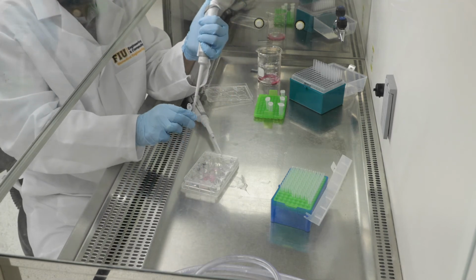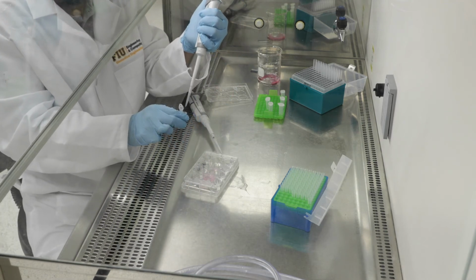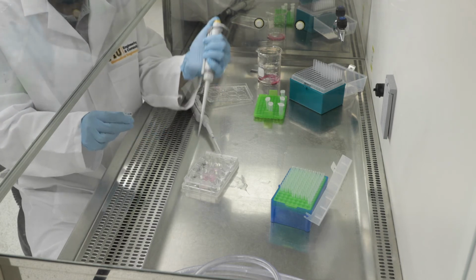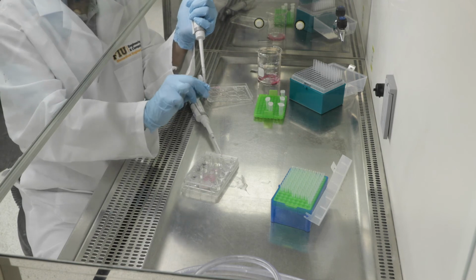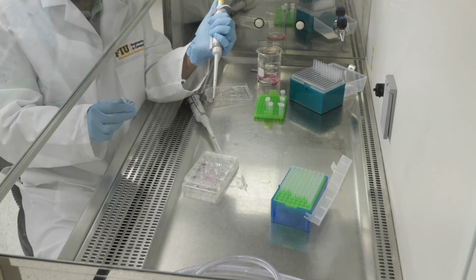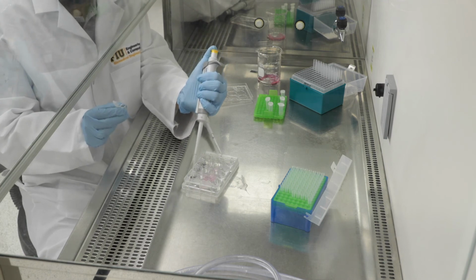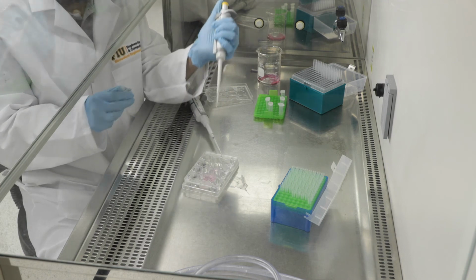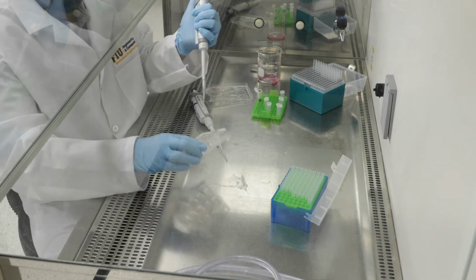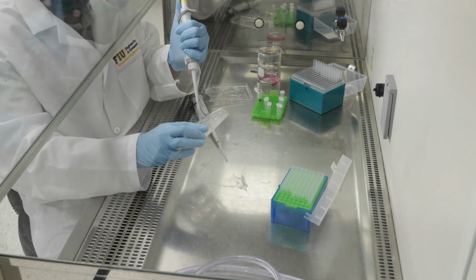After we've added the trypan blue, which we're almost done with for each of the 4 sections, we would need to incubate this in the incubator for about 5 minutes to allow the trypan blue to really get into contact with the gel construct and interact with the cells.